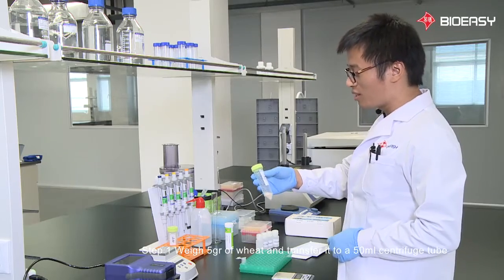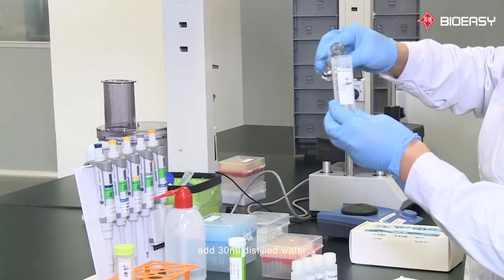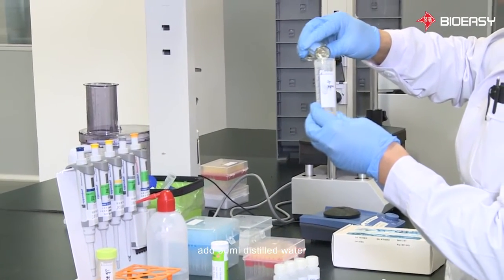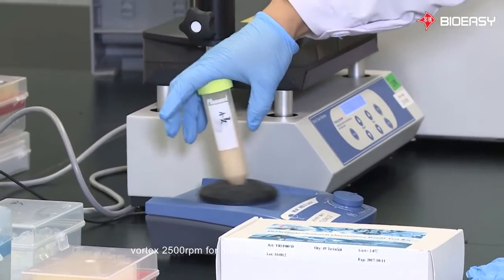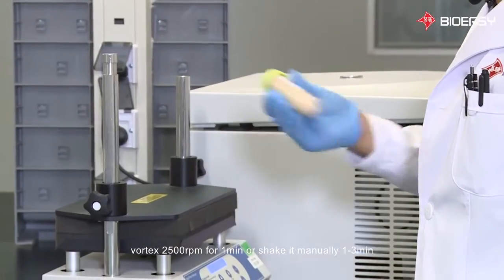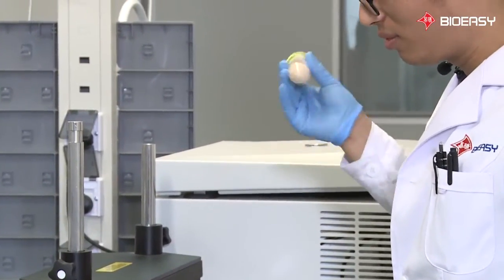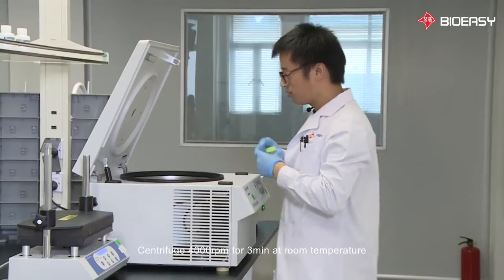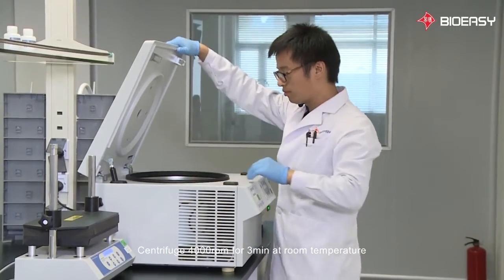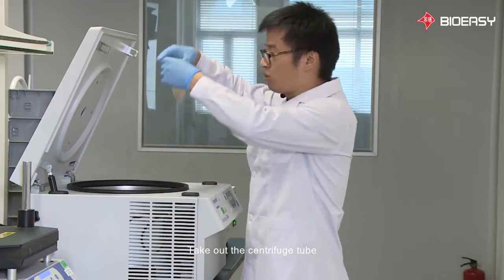Step 1. Weigh 5 grams of wheat and transfer it to a 50 milliliter centrifuge tube. Add 30 milliliters distilled water, vortex 2500 RPM for 1 minute, or shake it manually 1 to 3 minutes. Centrifuge 4000 RPMs for 3 minutes at room temperature. Take out the centrifuge tube.